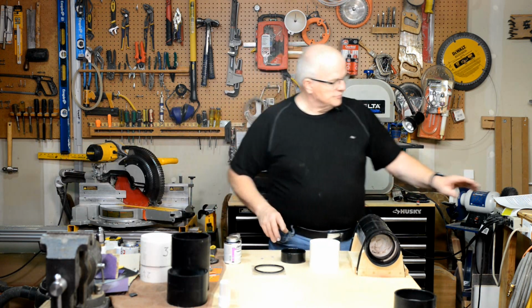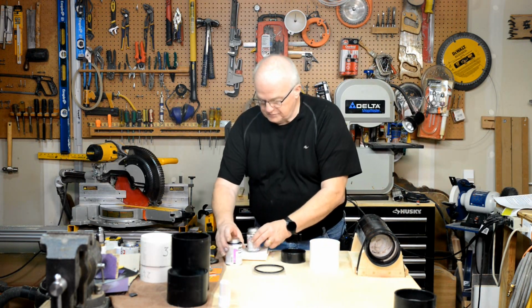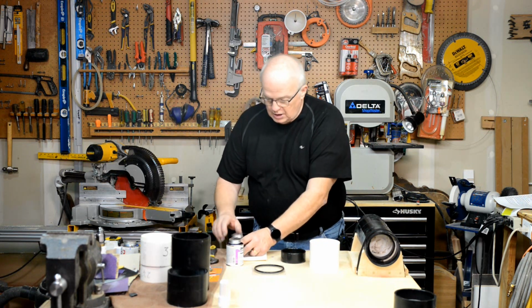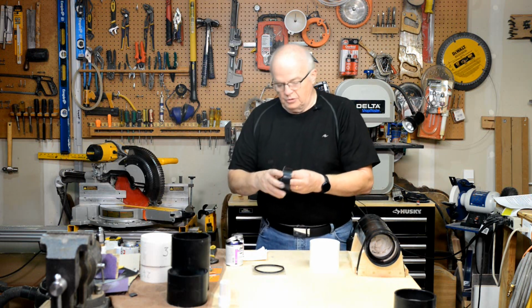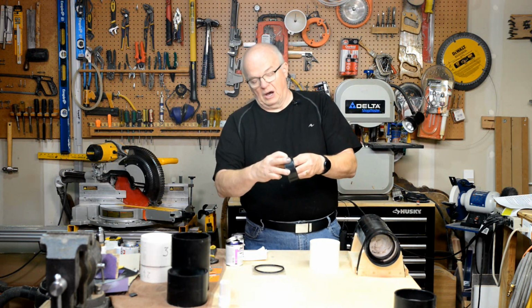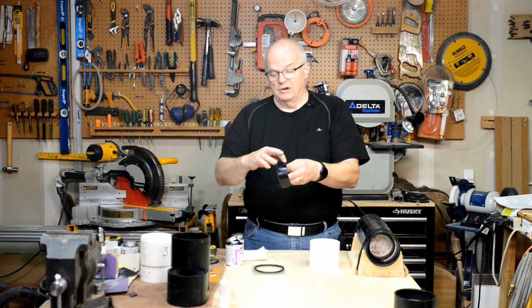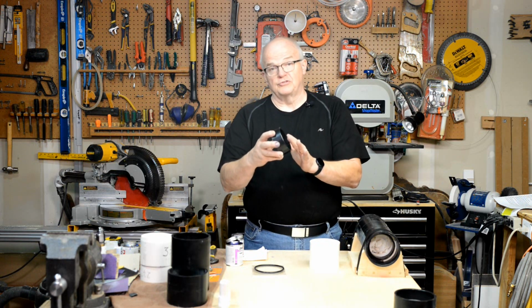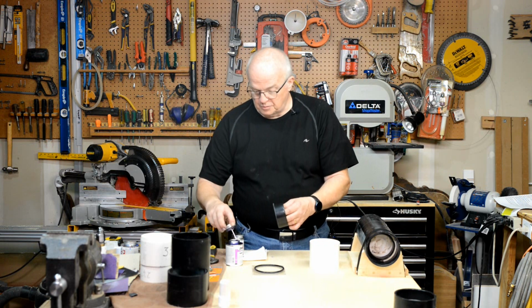Oh, I need to get this paper towel first. We're going to use the primer and glue. So we want to start with the primer, and we want to do this outside edge here. Go up about maybe an inch. Stay about a half an inch away from this smooth side. Okay, you don't want any primer on there. You don't want to do anything that's going to cause a deformity.